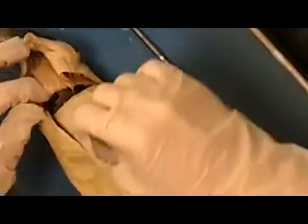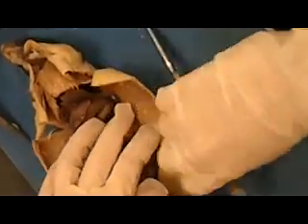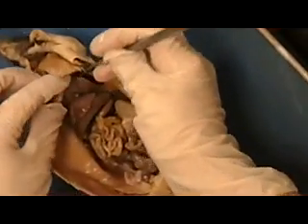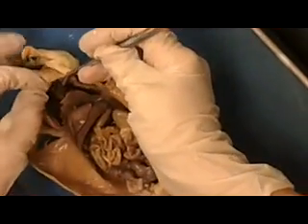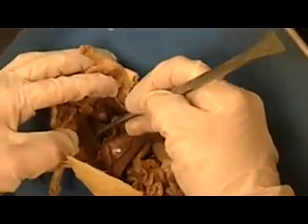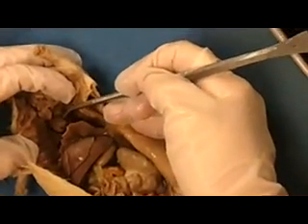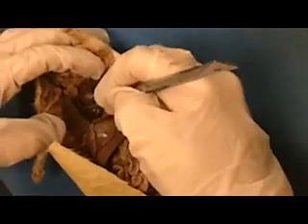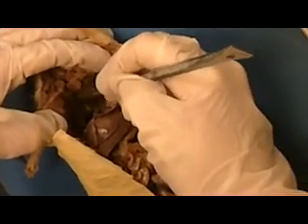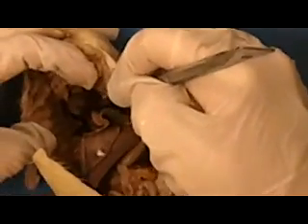Now the thoracic cavity is separated from your abdominal cavity by what we call the diaphragm. The diaphragm is just a muscular structure, and you can see it right here. Alright, so open up the thoracic cavity. You can see the lungs on that side and a lung on this side, and the heart sits in the center. The lungs are lobed, and so that's why it looks like there's more than one, but you actually only have a right one and a left one.